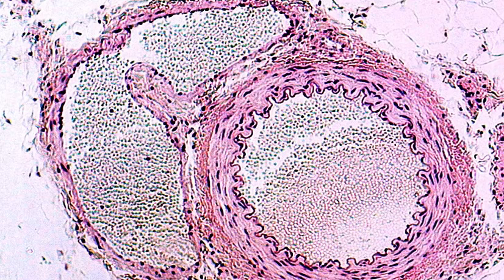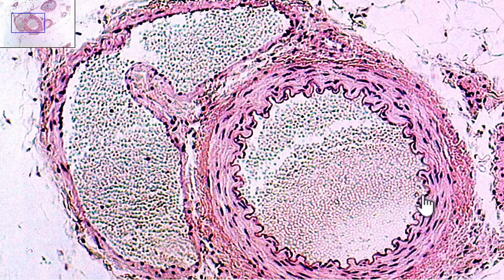Now both the arteries and veins are going to have three distinct layers, or three distinct tunics. This very thin dark line in here that's touching the lumen, which is the inside here, this thin line is the tunica intima. It's the most internal tunic. It's typically made up of epithelial tissue, simple squamous, therefore it's nice and smooth.